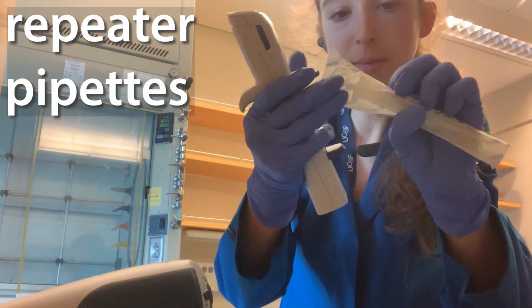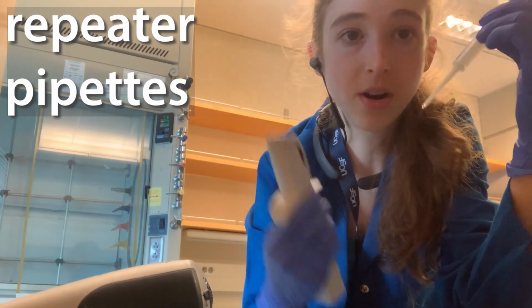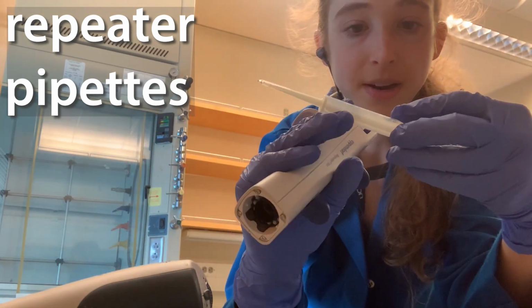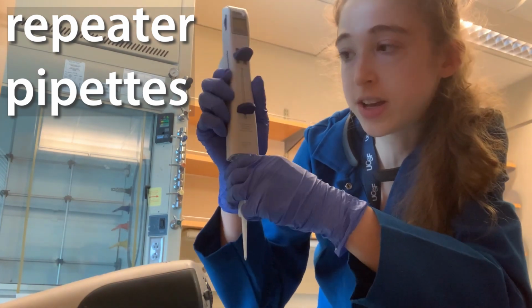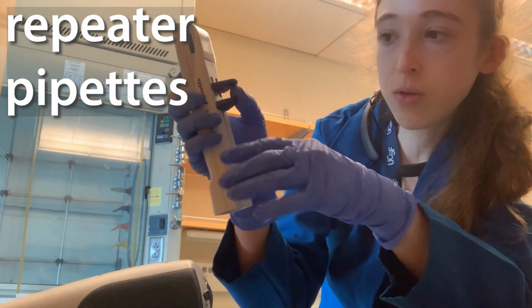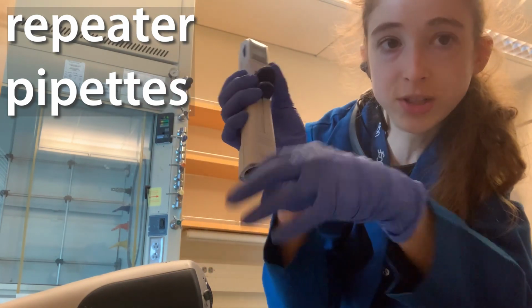Pipettes are going to come in a variety of different sizes, and the sizes are going to be this tip. So this part's going to be the same for all of them, but these tip sizes are going to be different, and the smaller the tip size, the finer the gradations that you can do. To load one of these, you push down, and then you're going to draw up. When you draw all the way up, there's going to be a little extra liquid, so you want to squirt that out.